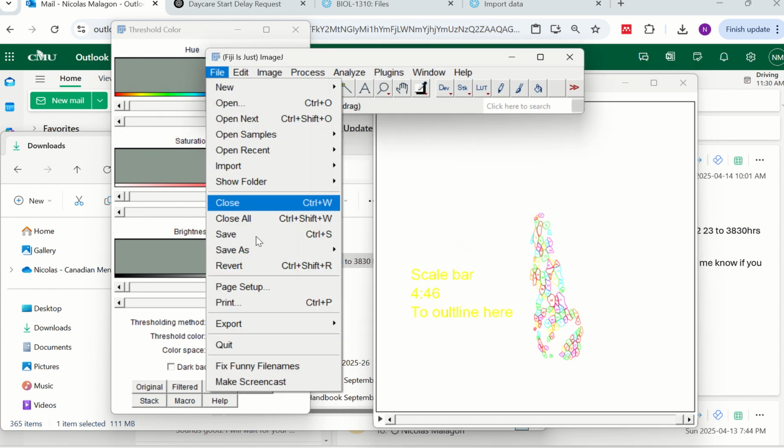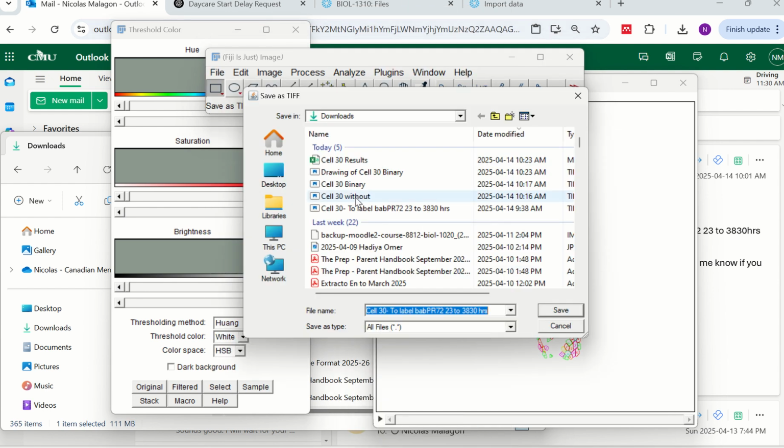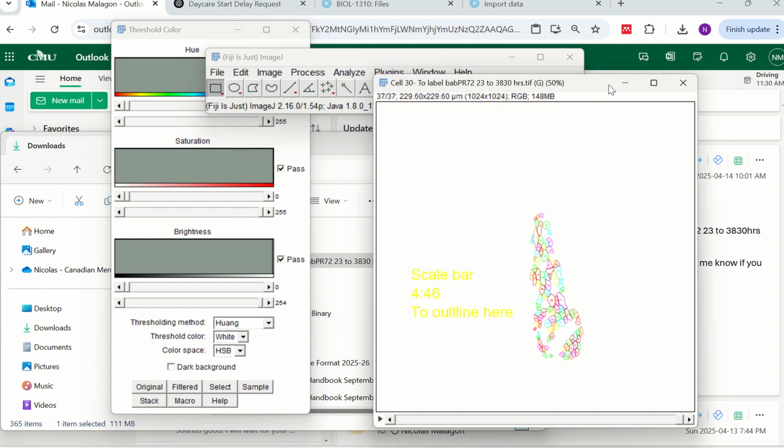So let's save it so we don't have any problem. So look, you go Save, TIFF, and look, you can call it as you want. Save it without background. You can just save it there. Okay, I already did it, so I'm not going to write that. Then is the next thing.